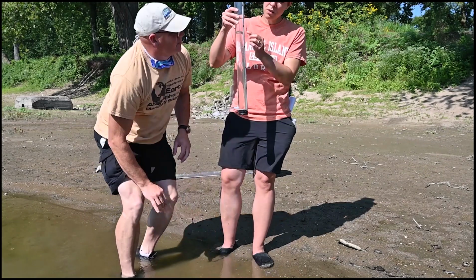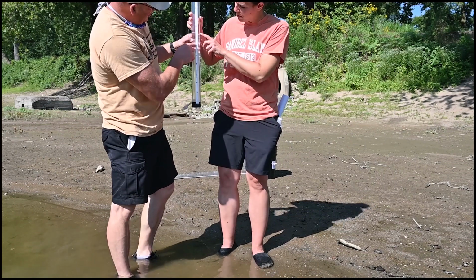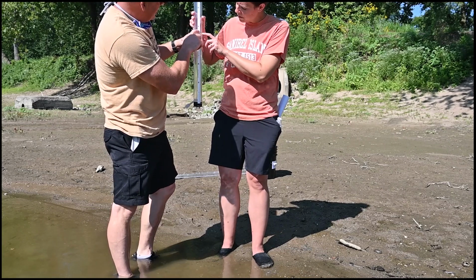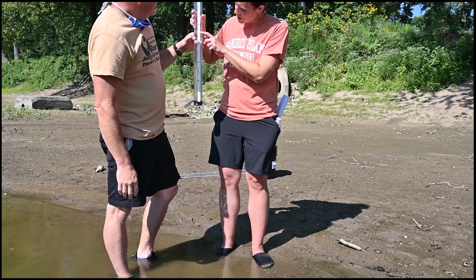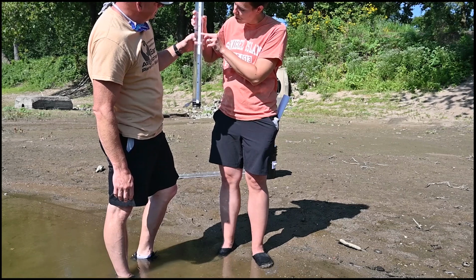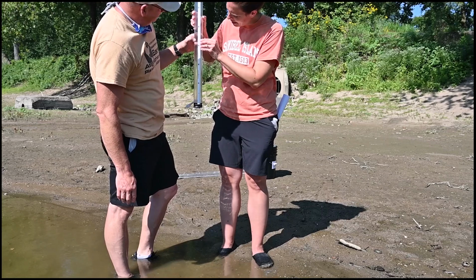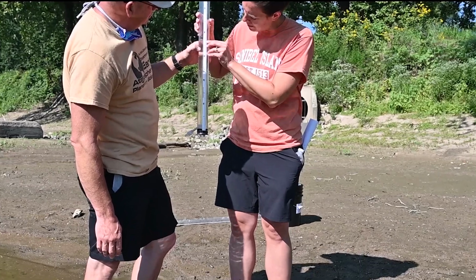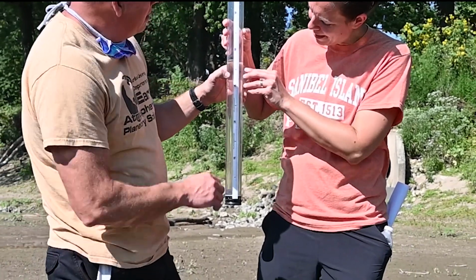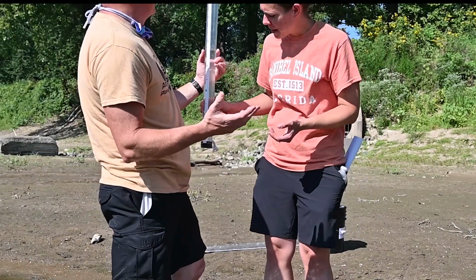All right. So the next thing we do, there is a scale here, and we're going to take a reading. Where are we? There's 35, 36, 37. It's halfway between 37 and 38, it looks like. And we see marks for the ones, and then marks for every 2 tenths places. So we're going to say 37.6. And that 0.6 is an estimation.